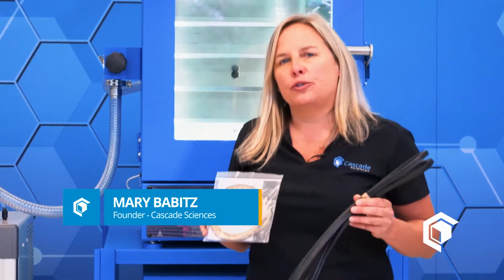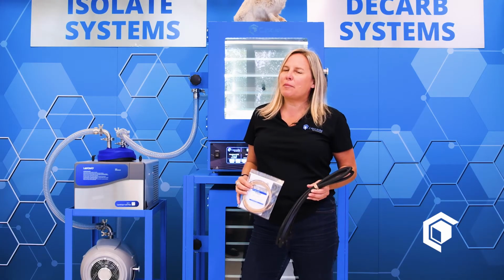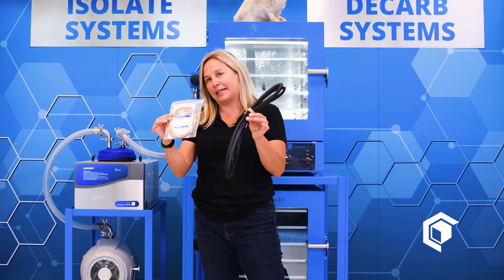As you know, we sell vacuum oven packages, which is a turnkey system with everything that you need to run a vacuum drying or vacuum purge process. However, there might be one more thing I want you to consider, and that is our vacuum package maintenance kits.